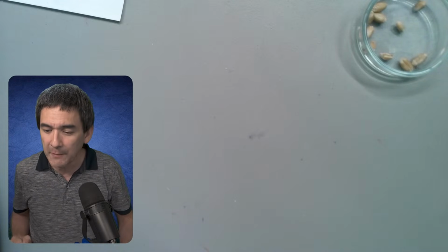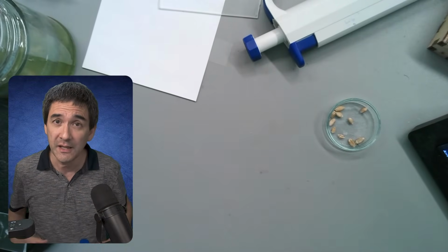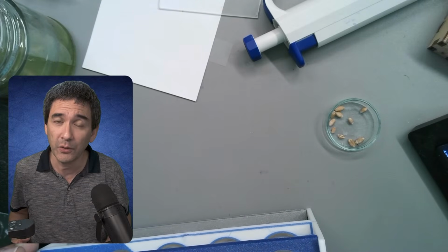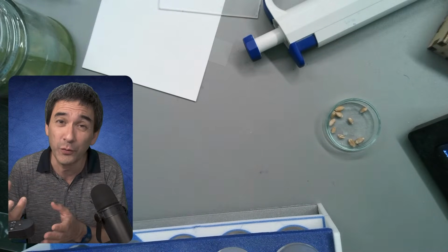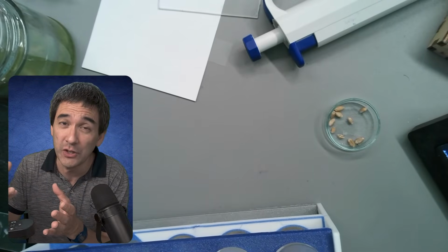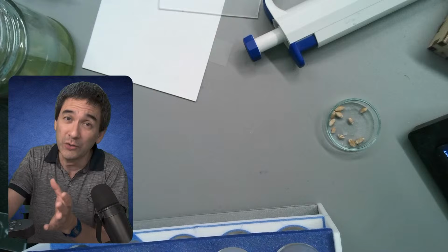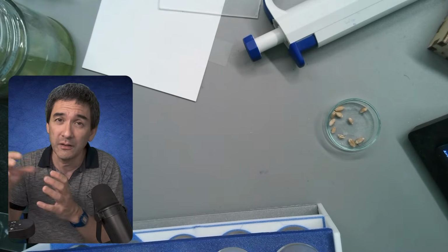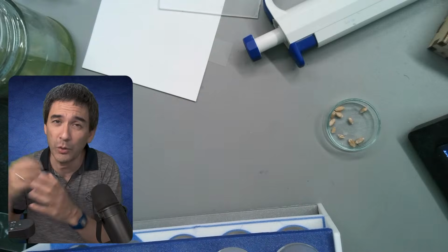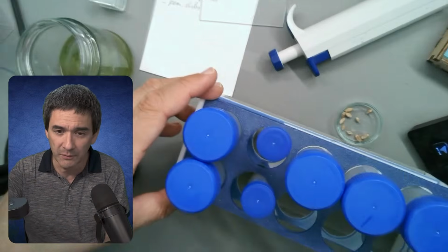Yes, thank you. Basically, it's like this: algae will absorb the nutrients, and therefore accumulate many of the nutrients. Then unfortunately they also die off and start decomposing, and they put those nutrients back into the water. So unless you're removing the algae, the amount of nutrients in the water will more or less stay the same. Yeah? So let's have a look at what I've got here.